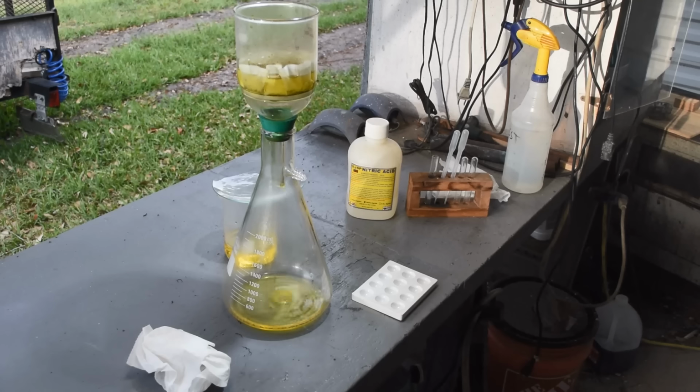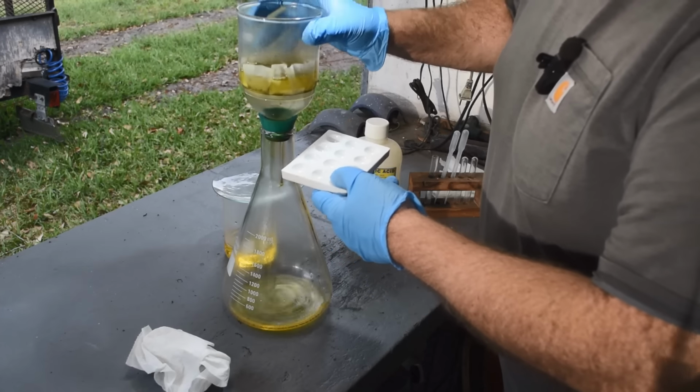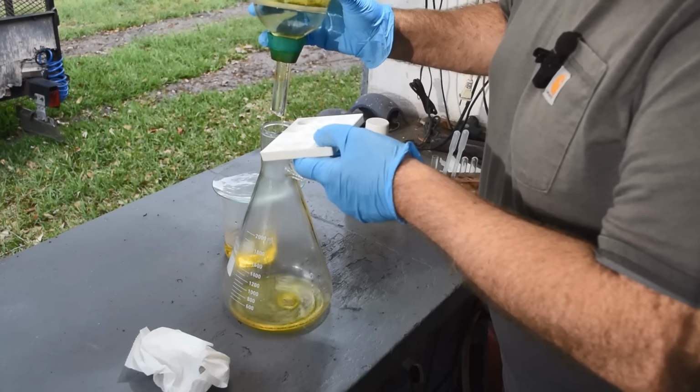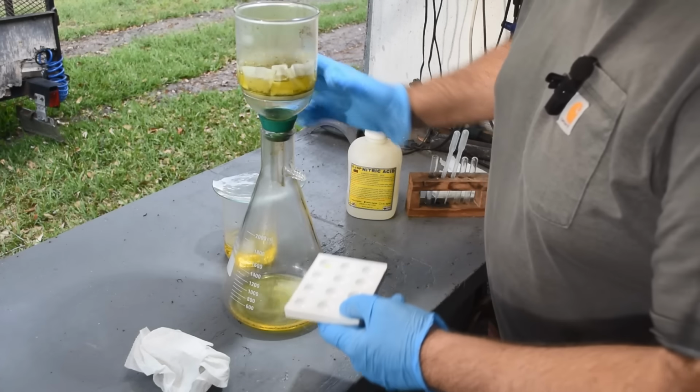So you may well be wondering to yourself, if you haven't seen any of my gold leach videos before, am I really getting any gold out of this? This looks sketchy, right? Well, let's see. Let's see if we're getting any gold out of it. Let's do a stannous chloride test. I really only want one drop, but I'm probably going to get more. There we go. There's one drop. Good.